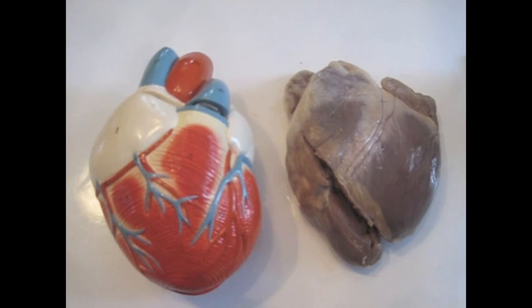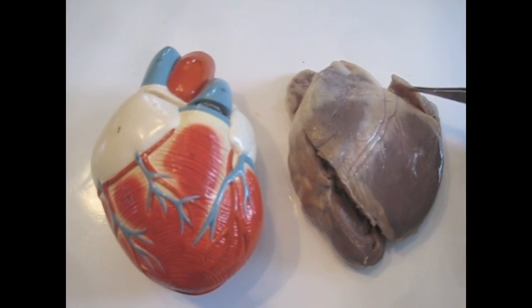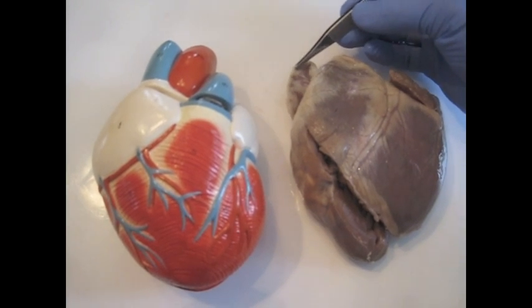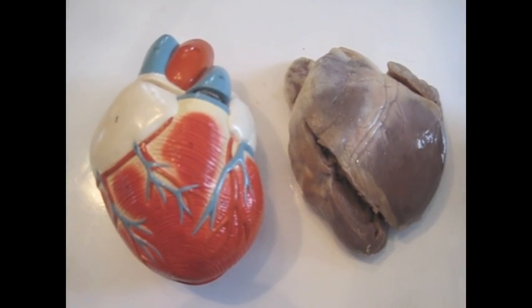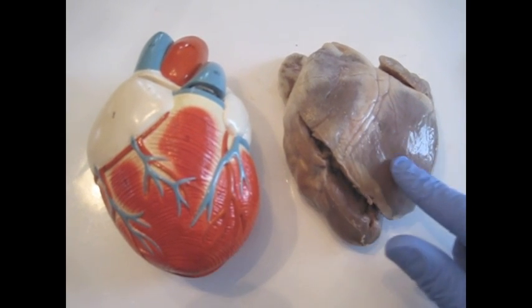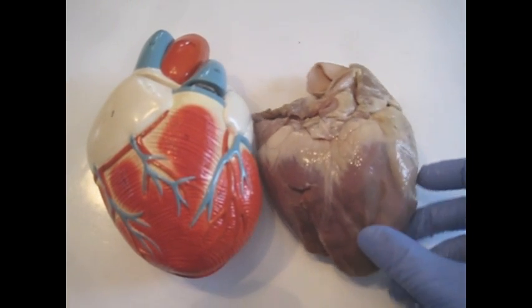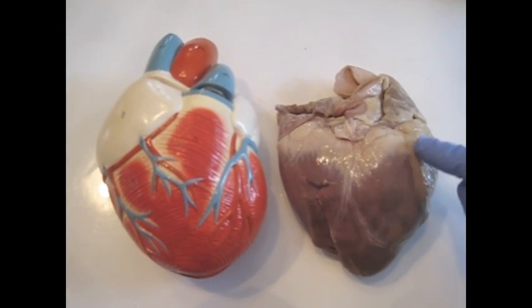Above the ventricles lie the atria. Superficially, they look a bit like ears, and they're called auricles. So there's one, and here's one. The question is, what is the left ventricle and left atrium, and what is the right ventricle and right atrium? And we know this is a ventricle, and this is a ventricle.